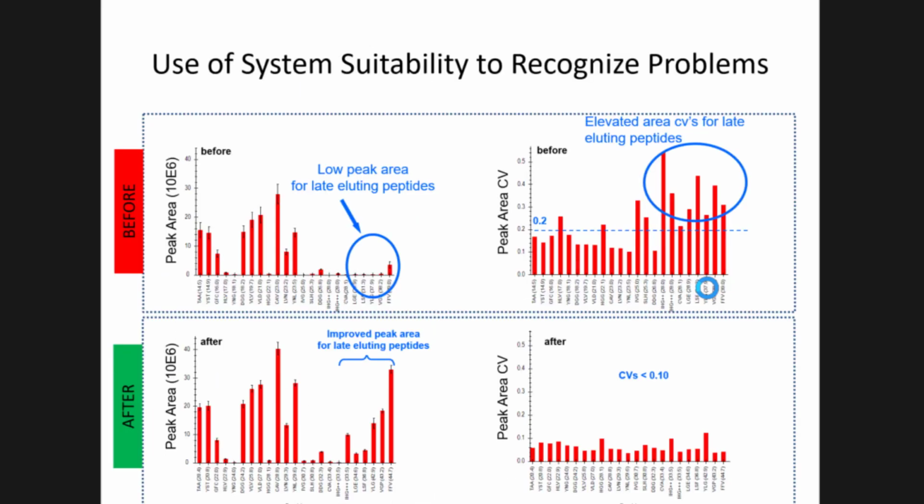So this was one of the reasons that we started evaluating system suitability in a study-wise format. We had one lab that was running system suitability when we just started. These are peptides ordered by retention time. The later eluting ones were all very low intensity, and we thought that was odd. And the early eluting ones seemed to mimic that of other labs.